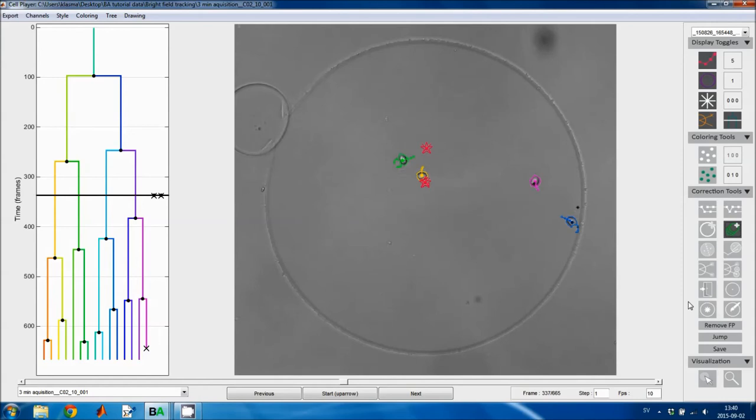This tool allows you to create a chain of such objects, or a track of such objects. So you click on a center point in the previous image, then you get a partial link with a dot in the end, and then you can click somewhere in the image and the program generates a point object or an object inside an outline where you clicked, and then it moves to the next frame so that you can create more of these objects. And in this way you can generate a sequence of objects either in the background as point objects or inside other regions. When you select a different tool, the tracking ends.